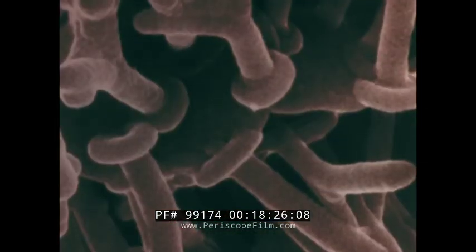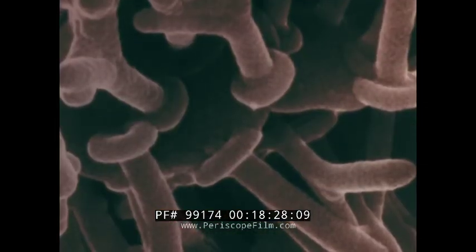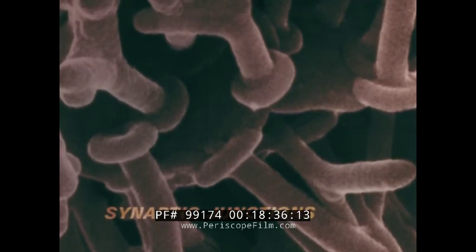These are cancer cells from a breast cancer. The significance of this configuration is not yet known. But this is not pathological. It's neuronal tissue taken from a marine mollusk. The knobs are probably neural processes related to the synaptic junction. They have a topography very difficult to see by any other imaging method.